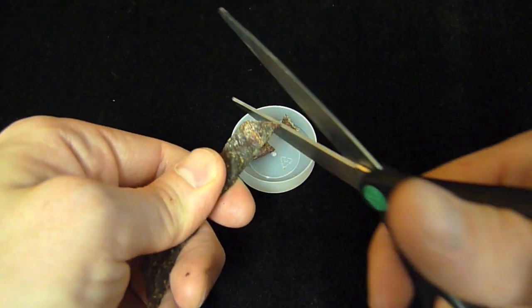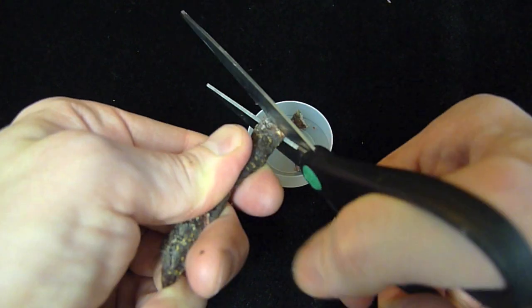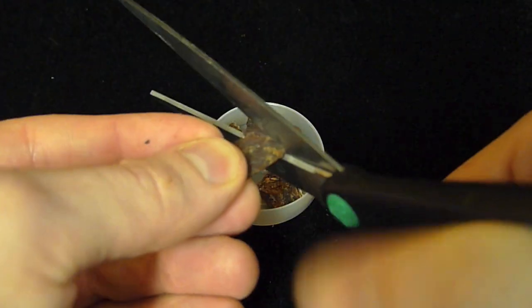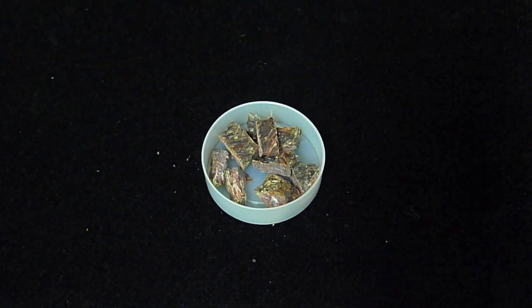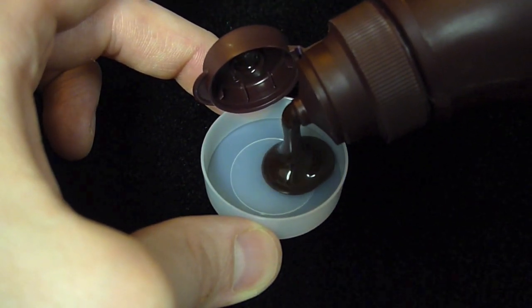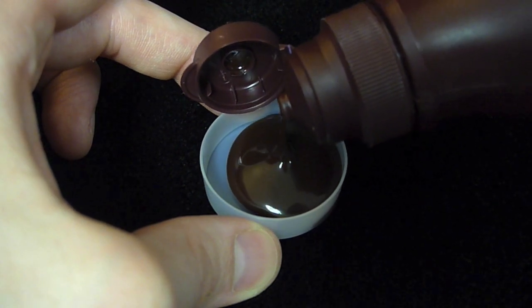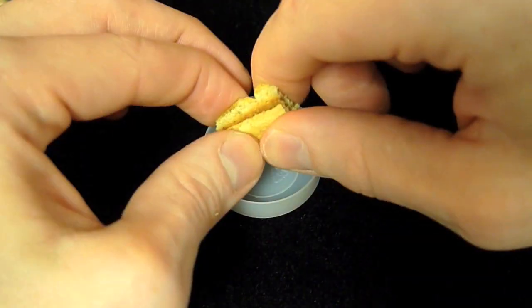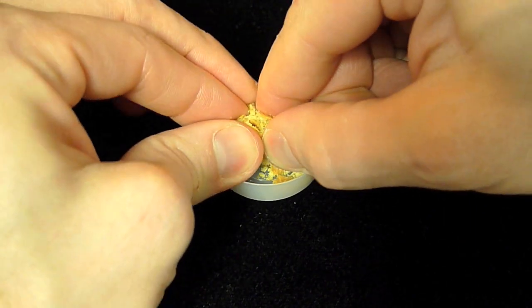When you're preparing something hard like this beef jerky, you can snip off several pieces with scissors. About this much will provide a good sample. Syrups and sauces are also easy to prepare — just make sure the sample covers the bottom of the sample cup and that the cup is no more than half full. As we saw earlier, cookies, crackers, and cake can be crumbled. Just cover the bottom of the sample cup with the crumbs.